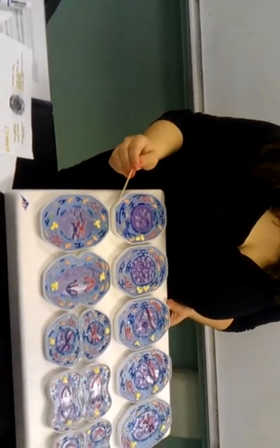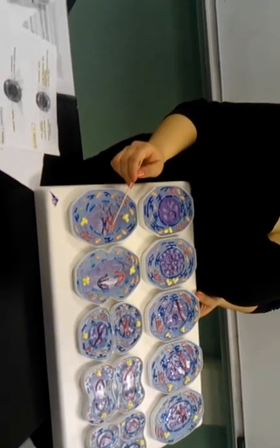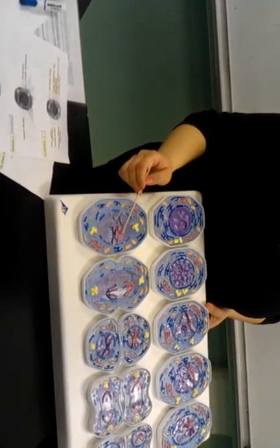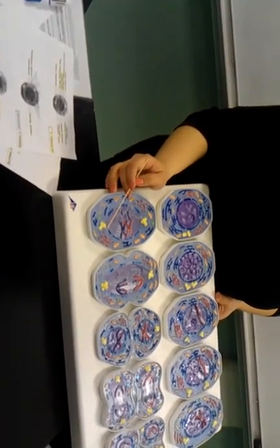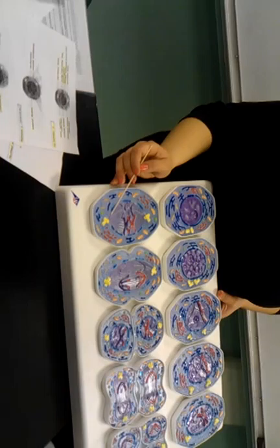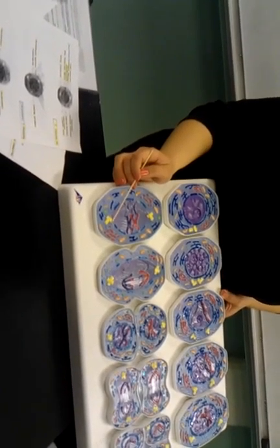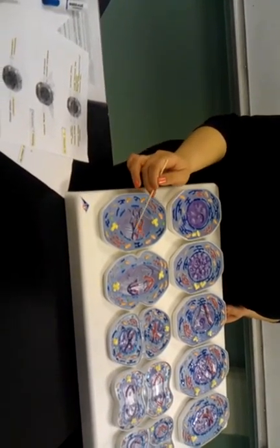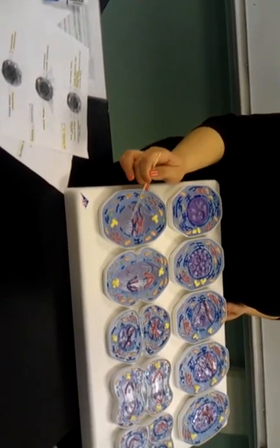All right. So then here, what do you need to know? So these are called sister paired chromatids. Okay, or sister chromatid pairs. Okay. Here we can see, I really can't see the centromeres. Yeah, the centrioles. All right. And then this right here, when they connect to the chiasmata, this is the chiasmata bridge.